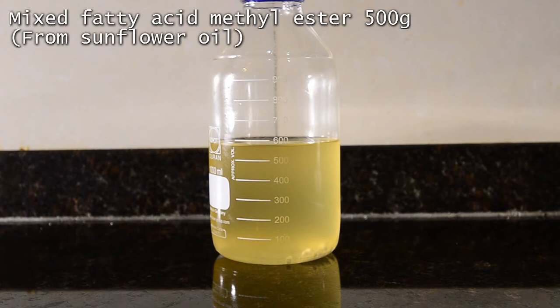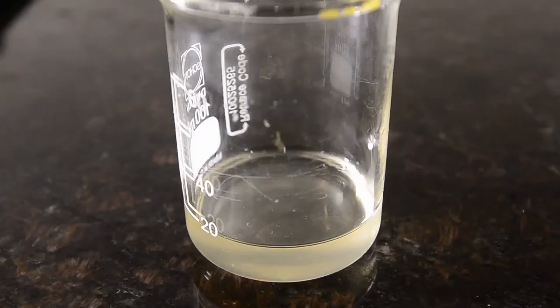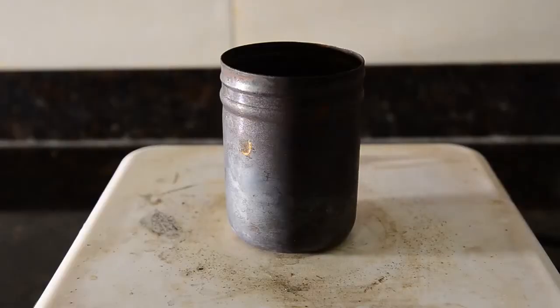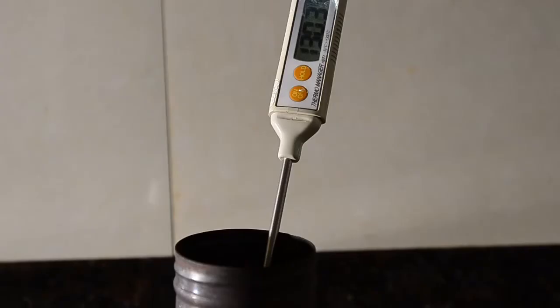We don't have an engine which has been tuned properly to test this on. However, we can do a little experiment and find the flash point of the liquid vapor. Here's 20 mils of the product. We poured this into our favorite metal shaker bottle and heated it on a hot plate, measuring the temperature using a thermometer.